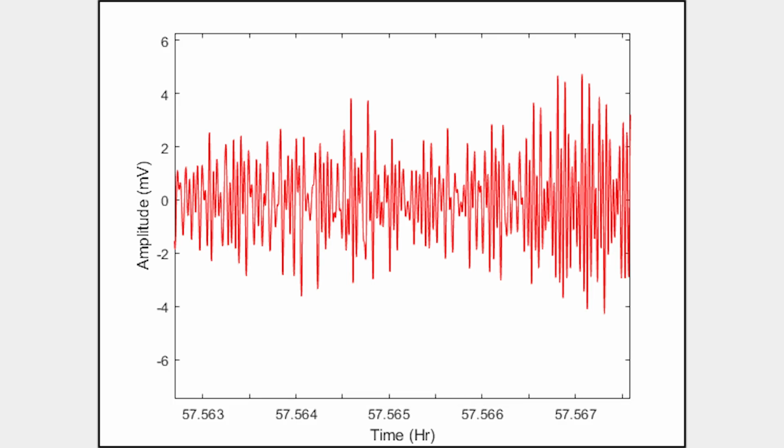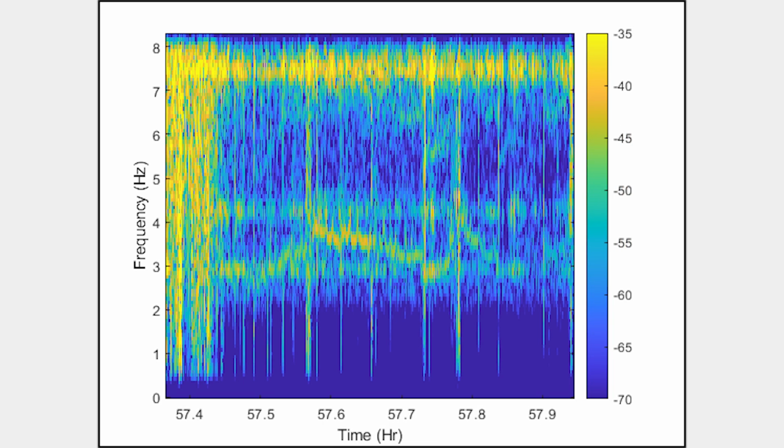This will likely make it difficult to separate low-level activity accurately into rest and sleep. With a typical mouse, this can result in a loss of accuracy on the order of 5%. For the last cage, we see both strong breathing and noise, where the noise over all bands is slightly greater than the breathing signal. This will have a similar loss as the other bottom shelf cage.